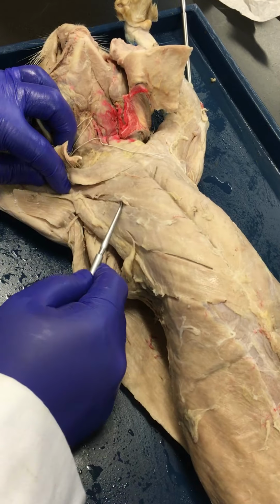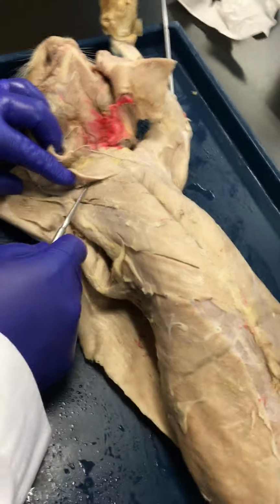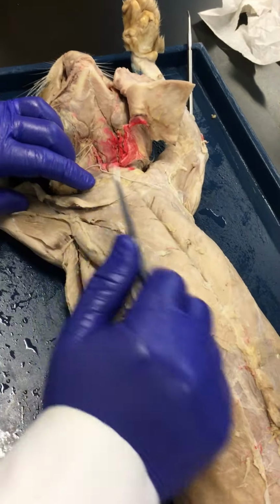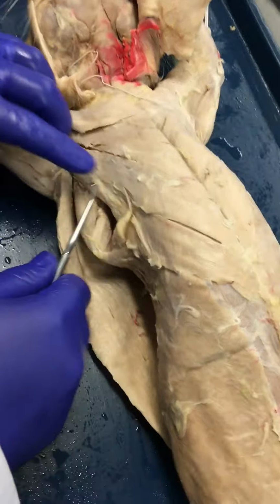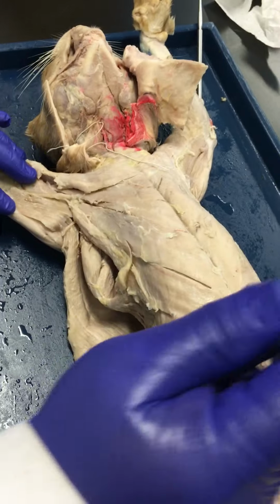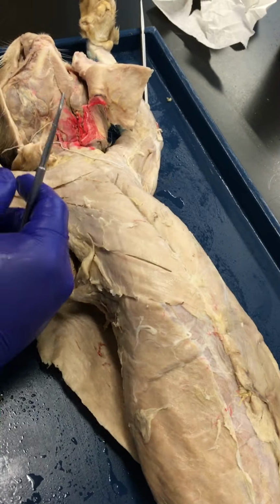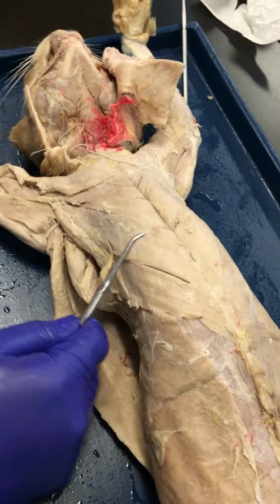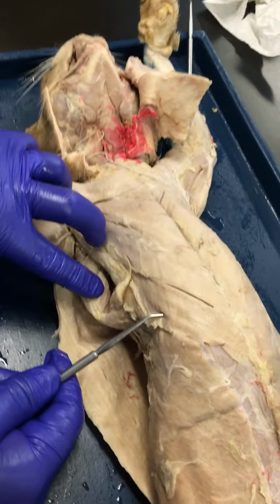As far as the pectoralis major, remember the action is to medially rotate that humerus, right? And it's also going to help with adducting the arm, ADD. Here's your pectoralis minor, which the action here is going to be to protract that scapula, so that you're kind of turning that scapula laterally and reaching out for something. So that's the pectoralis minor. And those are the two superficial chest muscles that we're interested in.